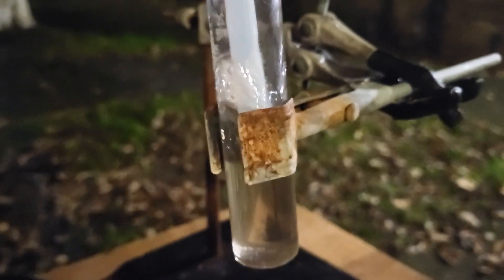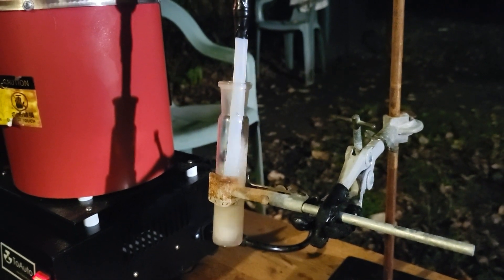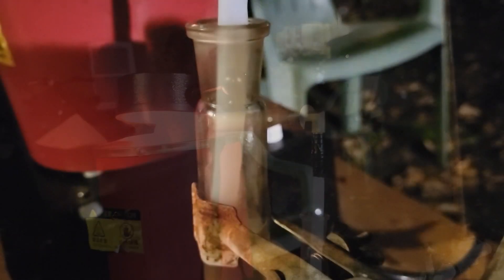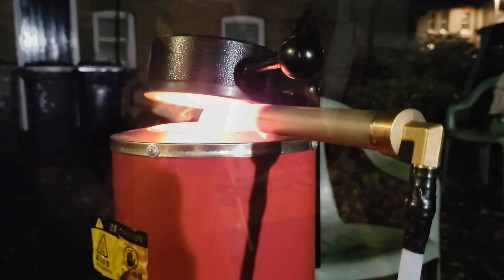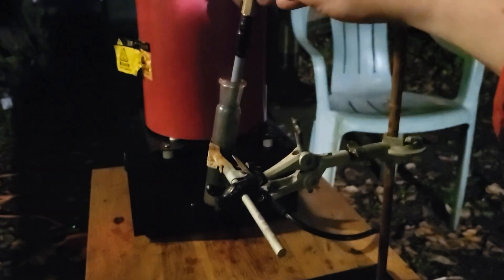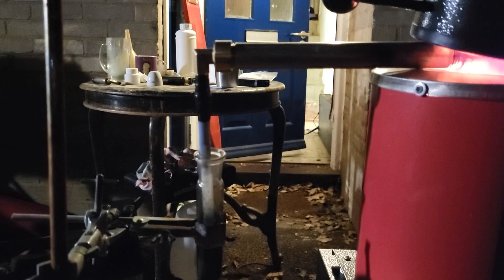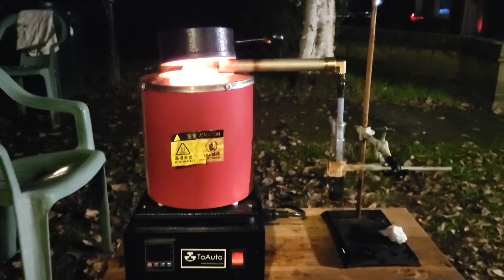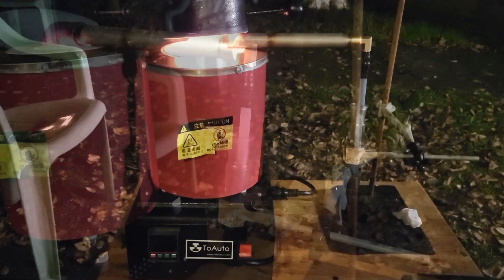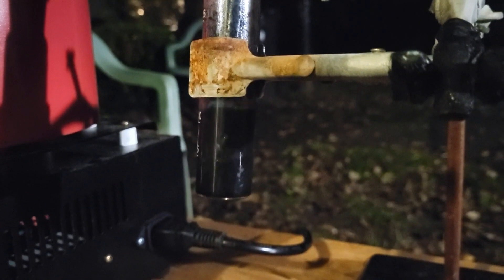We know what to do next time — not this. It's just like smoke. I just had it pointing down. I think something came over. I think the problem was the condenser was tilted slightly the wrong way. Waiting for it to cool. That plug has cleared itself — let's hope there's some potassium in there.